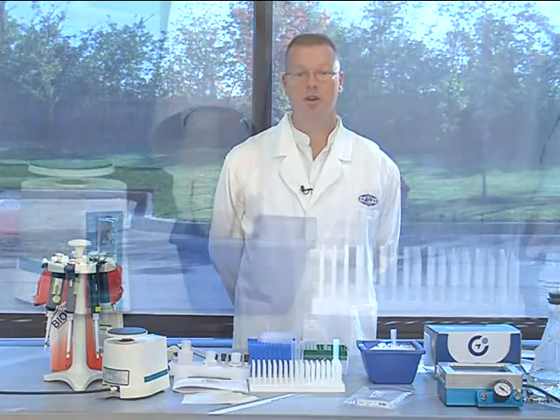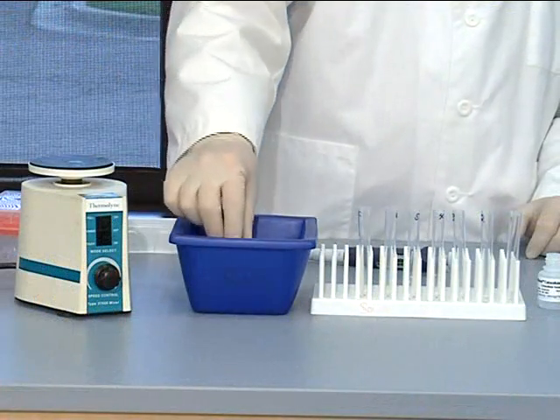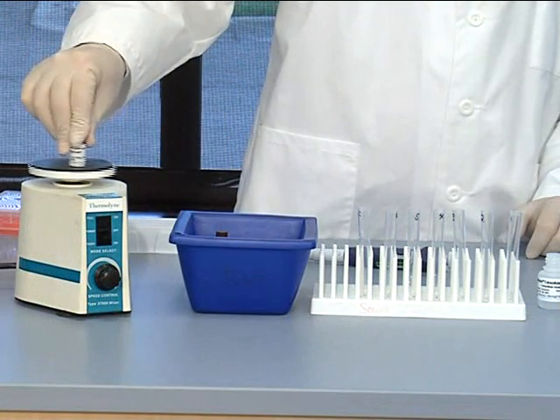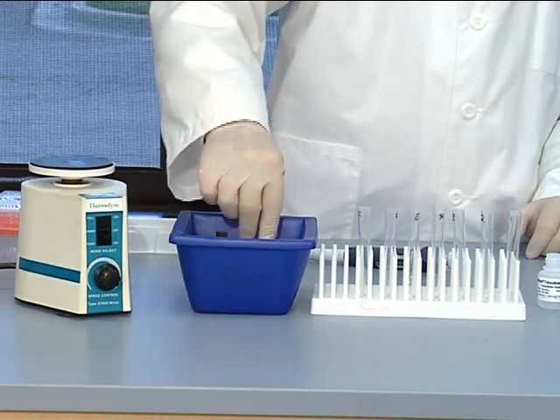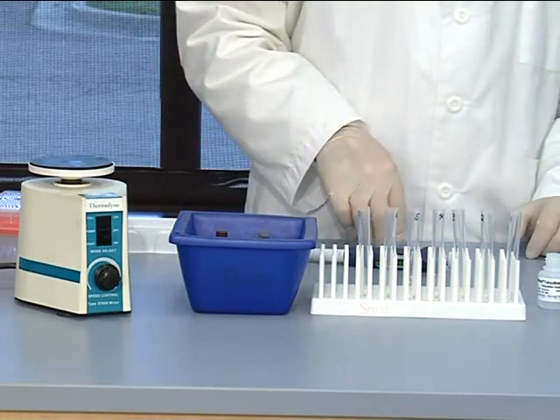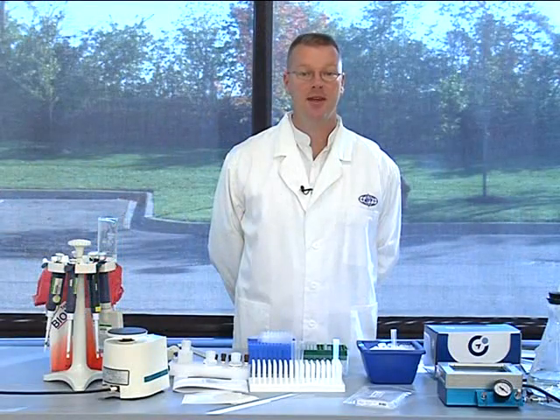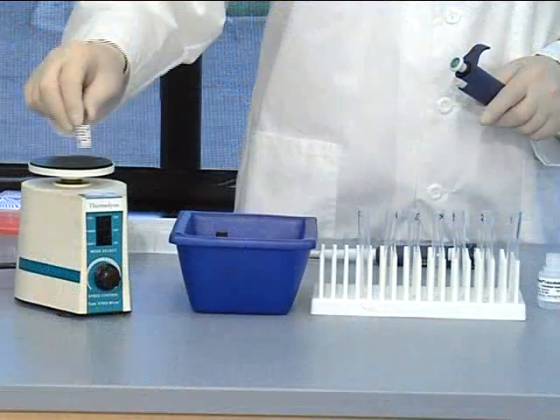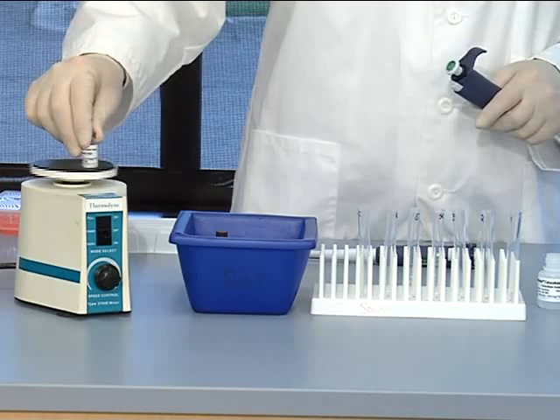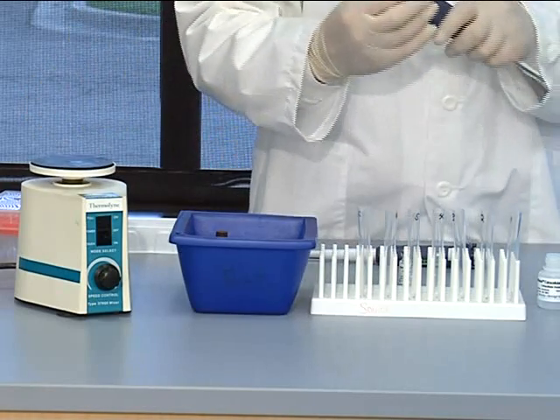As you prepare your standard curve, first reconstitute the lyophilized standard cocktail one vial with 250 microliters of extracellular assay buffer one and gently vortex. Wait for five minutes, then vortex again. This solution now contains 100,000 picograms per ml of each cytokine.